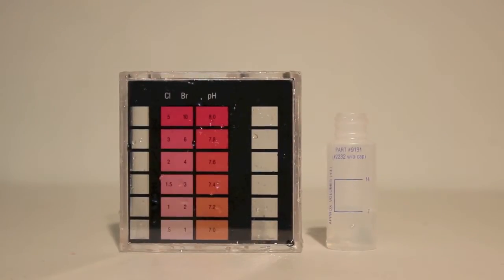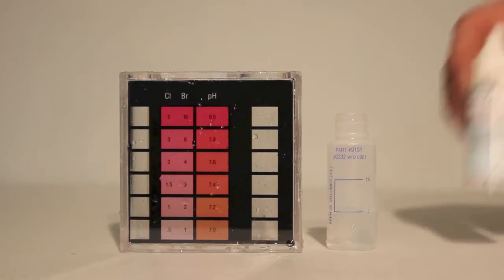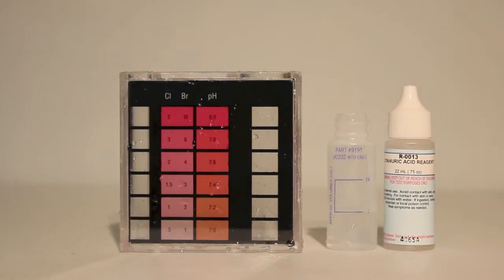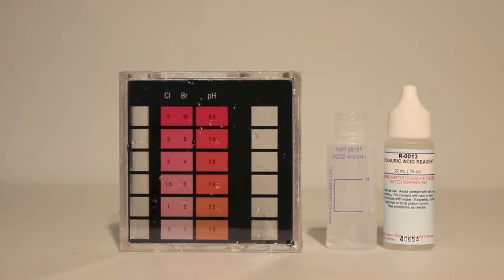We wanted to show you a cyanuric acid test. We've already filled the container on the right to line number 7 with our swimming pool water.